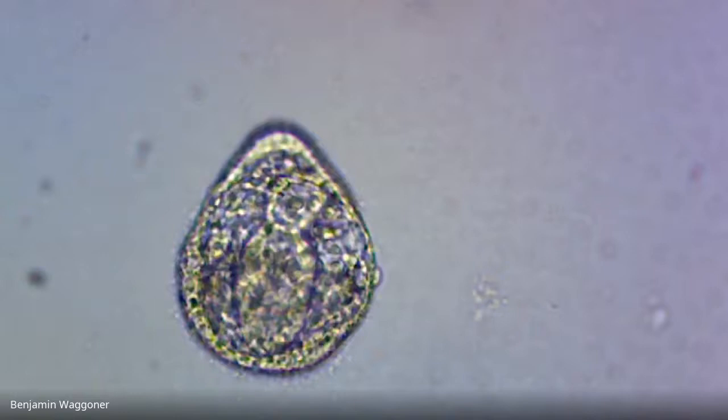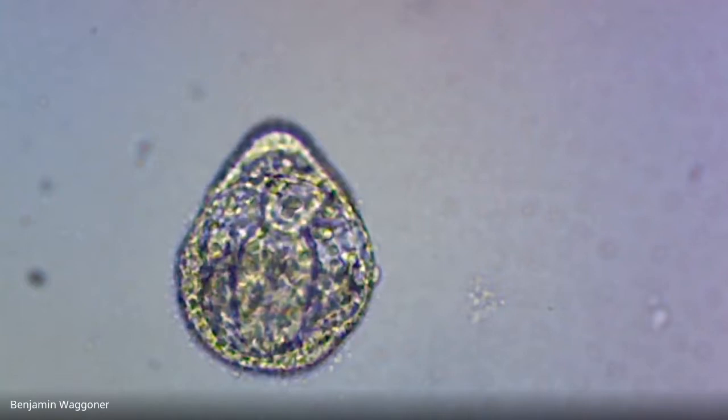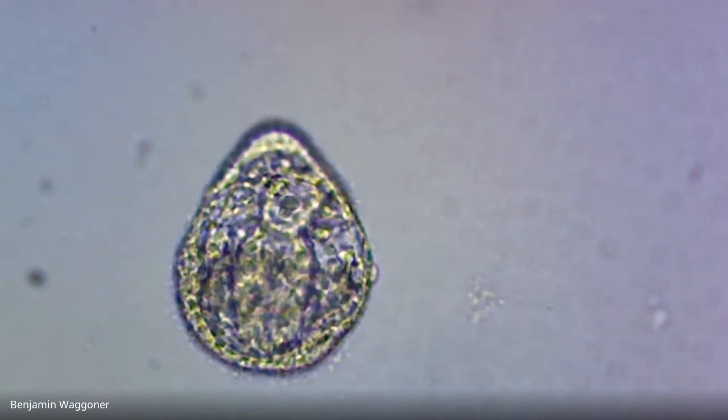And second, there's enough bacteria even in the nickel tank that it's hard to say how many of these screwed up larvae might be screwed up because they're being eaten by bacteria, and how many might be screwed up because of the nickel. We've got two variables here that I can't really disentangle.